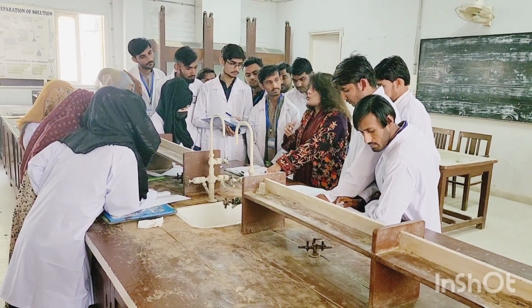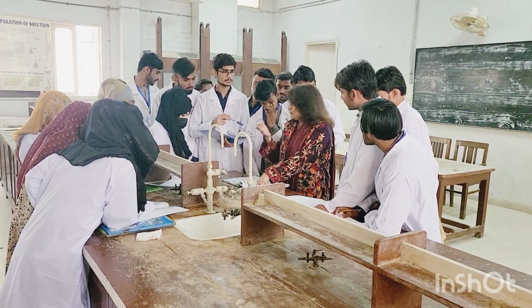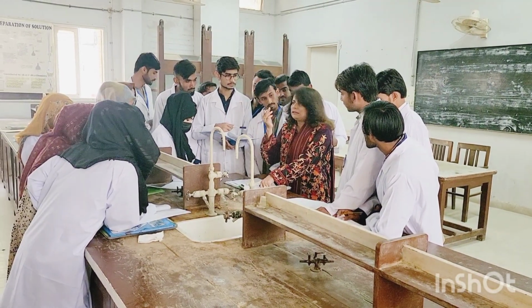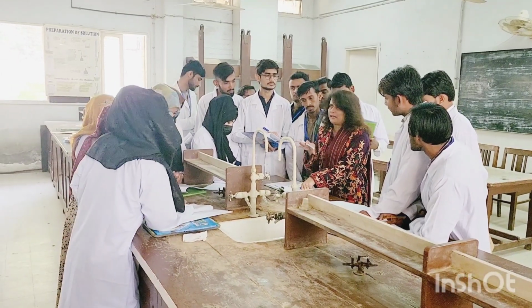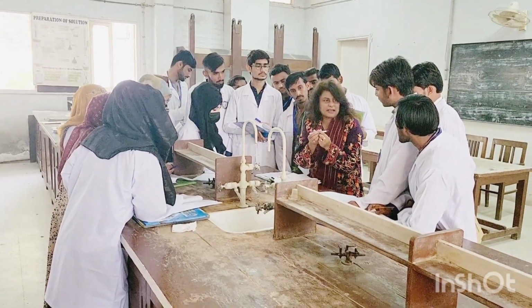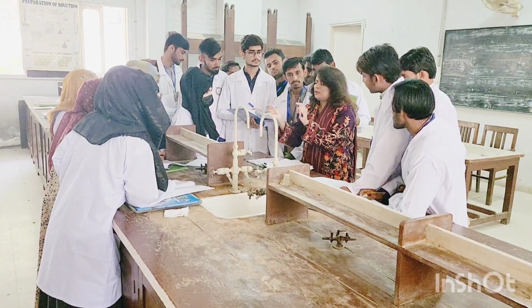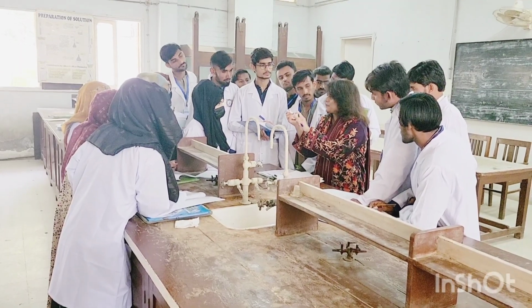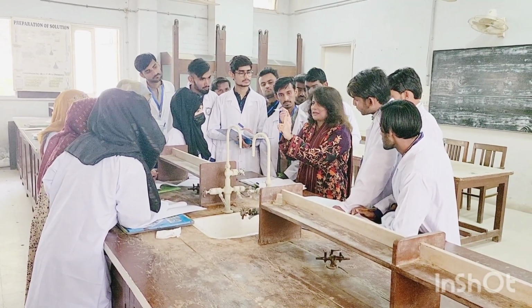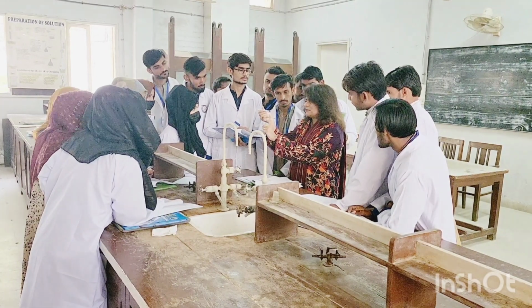Now ignition means to ignite, jala dena, ignite. Now that means हमें कुछ ना कुछ जलाना है. What we are going to do, we will take a spatula, a metallic spatula, nothing else, no test tube, nothing. Directly you will use a metallic spatula. If, for example, this is a metallic spatula, ठीक है? You are going to take a few granules of your compound over the tip of the metallic spatula, and if this is a burner, for example, you are going to burn directly over it like this.